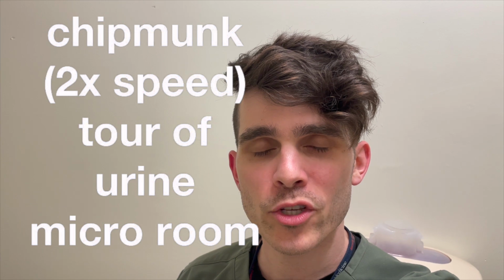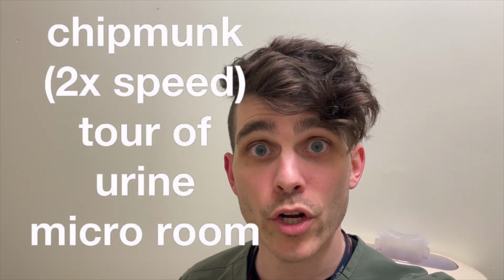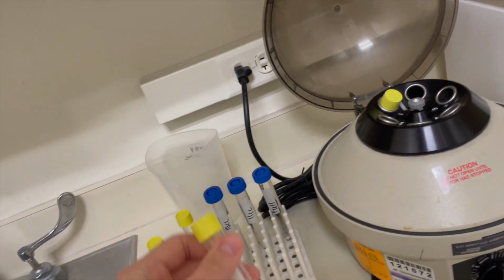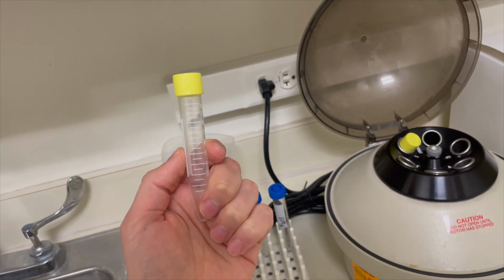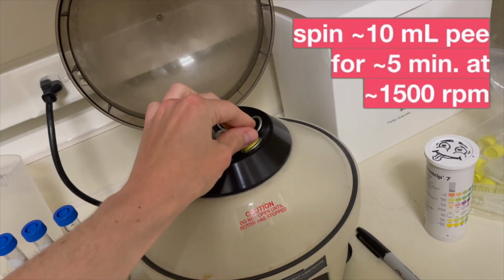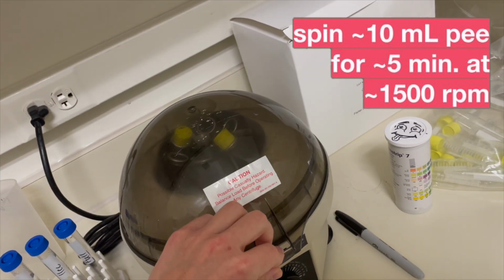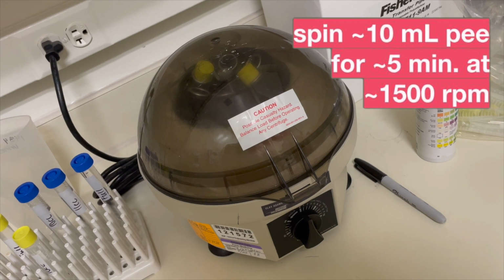Let's take a quick tour of the urine microscopy room so you can visualize what we do when we prepare a sample for urine sediment analysis. All right, we're going to take you over to this station here. The first thing you're going to do is, when you have the sample in hand, pour about 7 to 9 milliliters into a tube such as this one, and then set your sample into the centrifuge with a conveniently located balance weight already applied inside. We lock it down, we kick it up to 3 or 4 minutes, and we let this bad boy go.